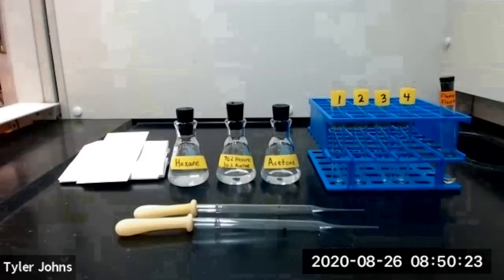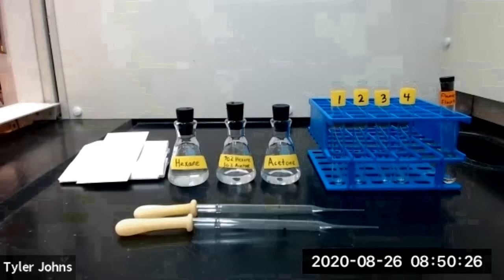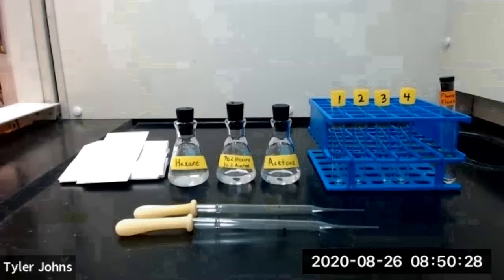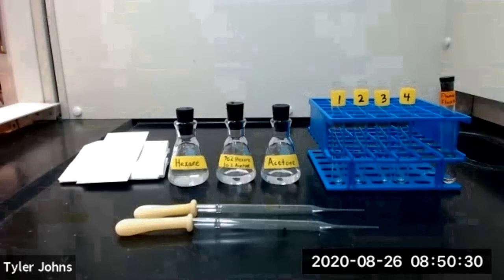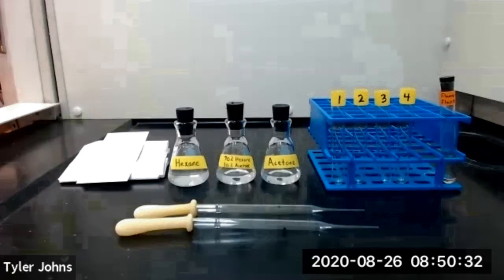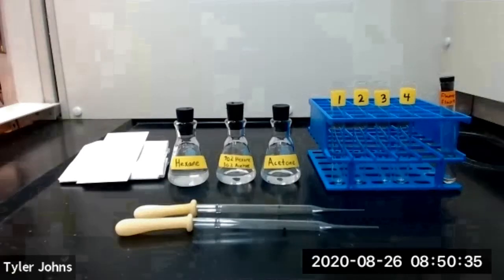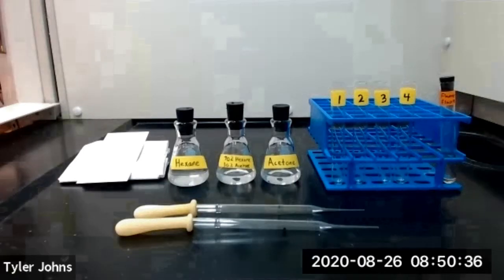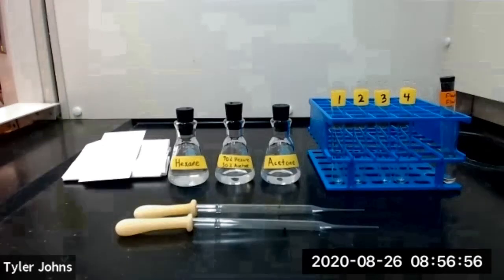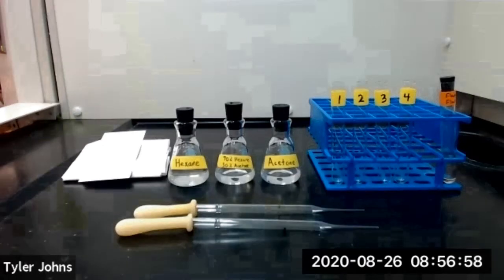In part D of this experiment we're going to use column chromatography to separate a mixture of fluorene and fluorenone. We'll then test the purity of our separated compounds using TLC and melting points. Before we can run our column, we need to assemble the following glassware and liquids.